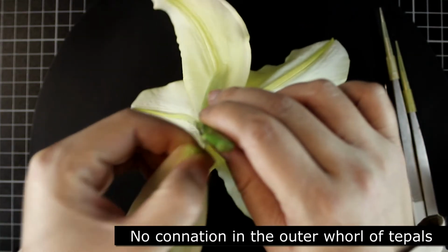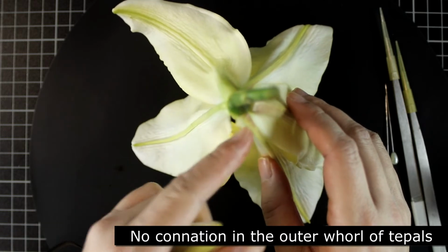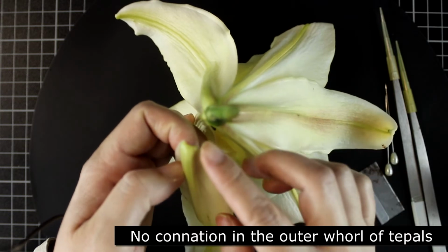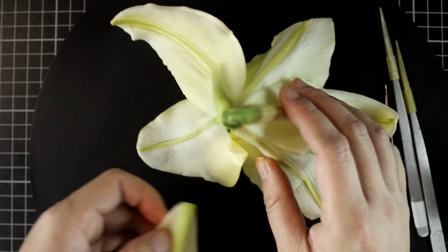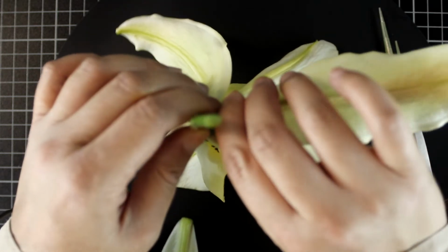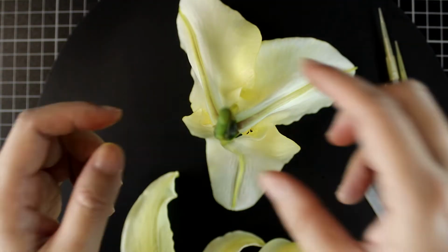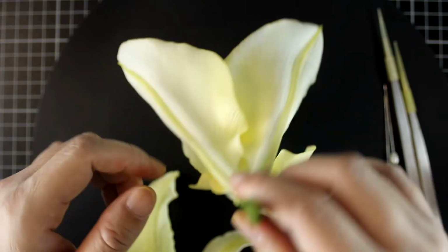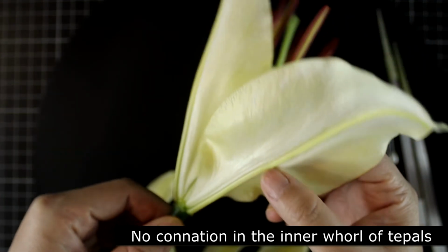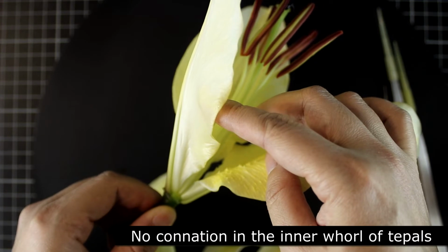So if I remove one tepal, we will find that it won't hurt other tepals because they are not joined at the side. So I remove 3 of them, the outermost whorl. Okay, so what you can find now is the inner whorl. And in the inner whorl, obviously, the tepals are not fused together. They're well separated too.